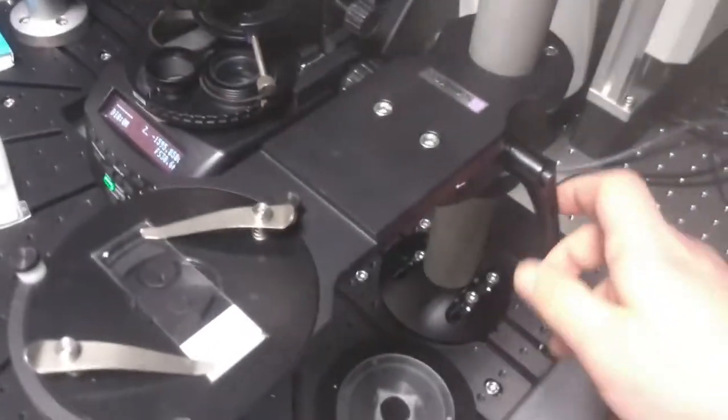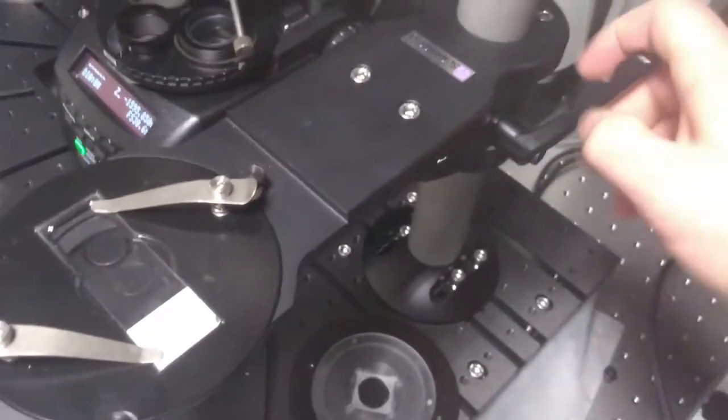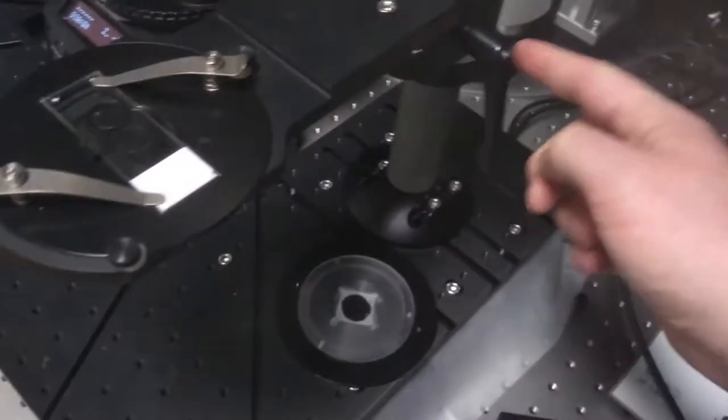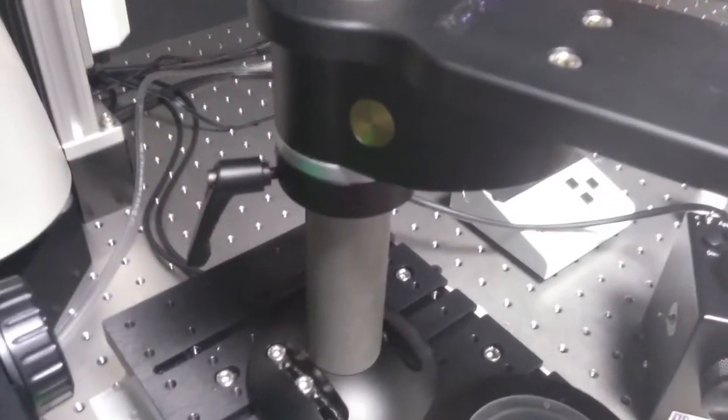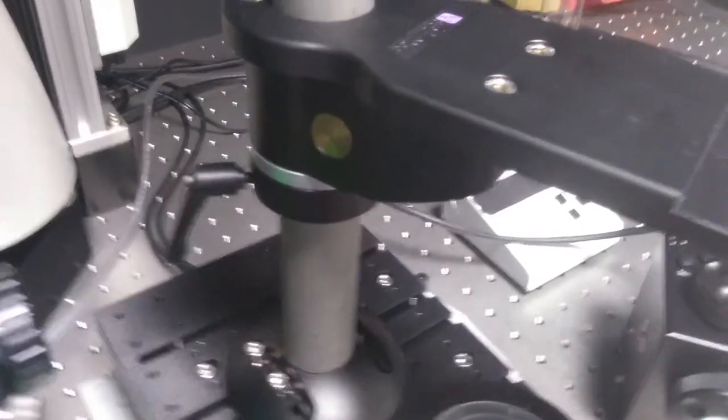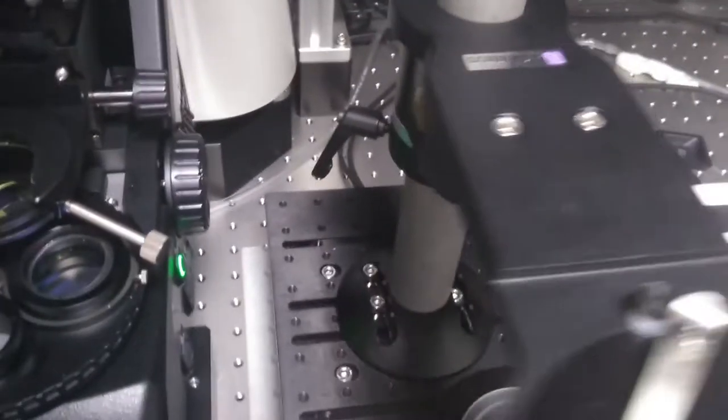The sample is mounted on a swing arm which can be loosened with this small arm here at the back, and then the sample arm will swing freely back and forth. Please take care not to loosen the height positioning ring, as this will make the stage drop.